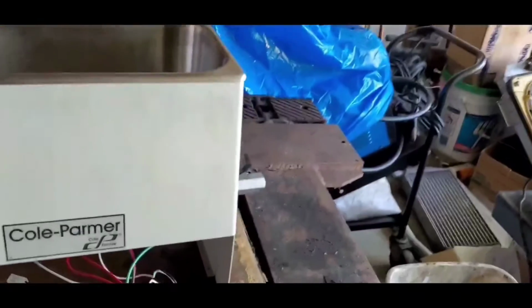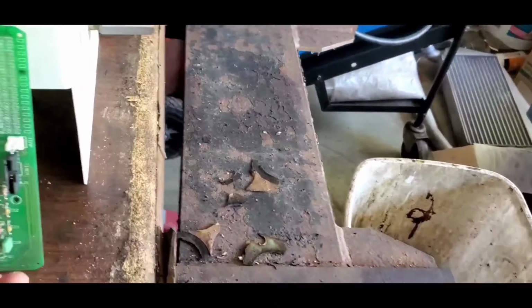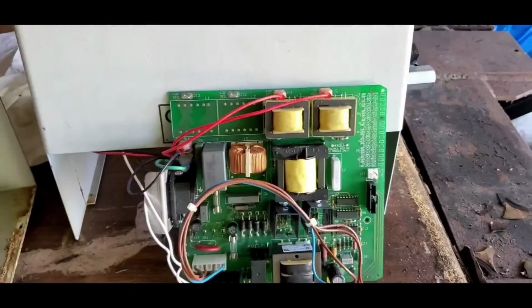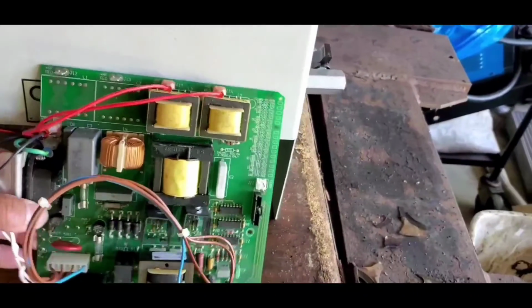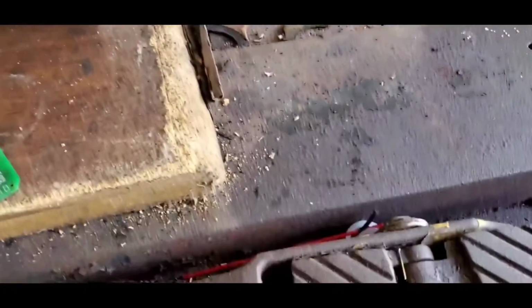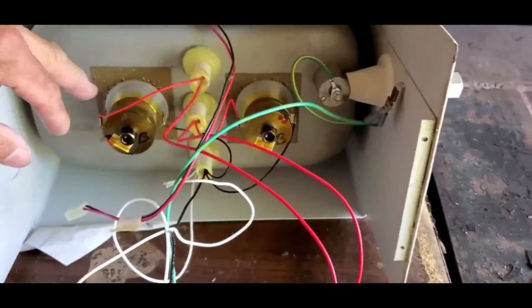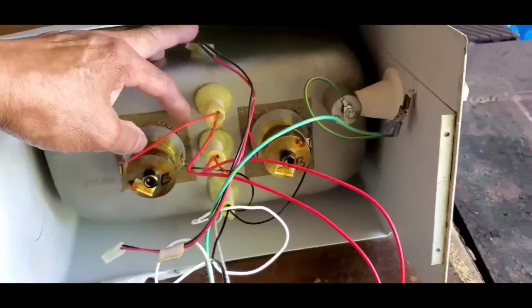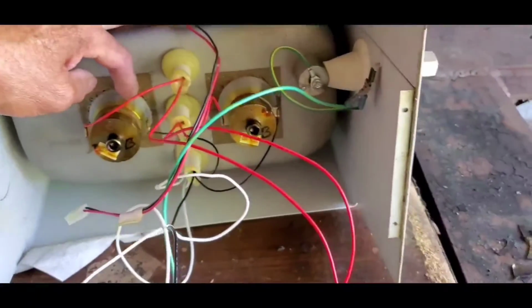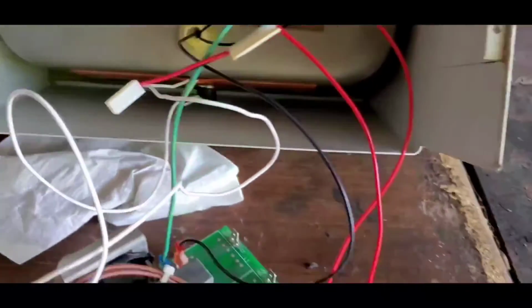And when it comes to the main circuit board, this is the one that controls the ultrasonic projector, or what you call that. And this is it, guys. There are two ultrasonic projectors, and these are the heaters. These three, and this is the thermostat that controls the temperature of the heat. And also there's another one at the back. I don't know if you can see it. It's right there. So there are two.